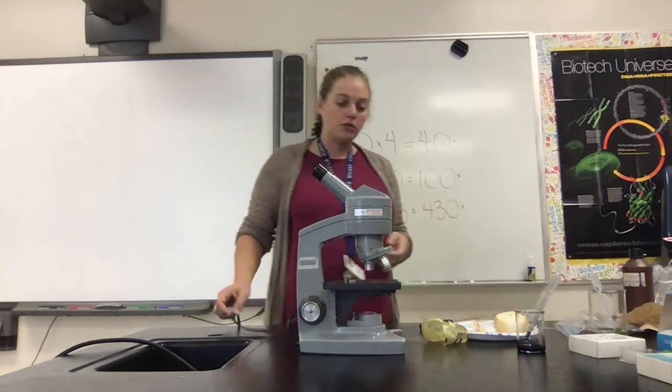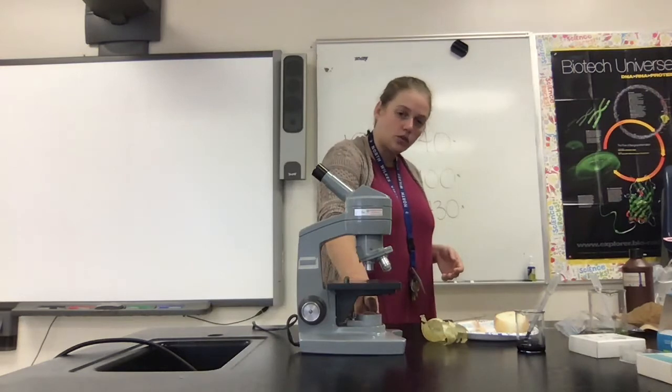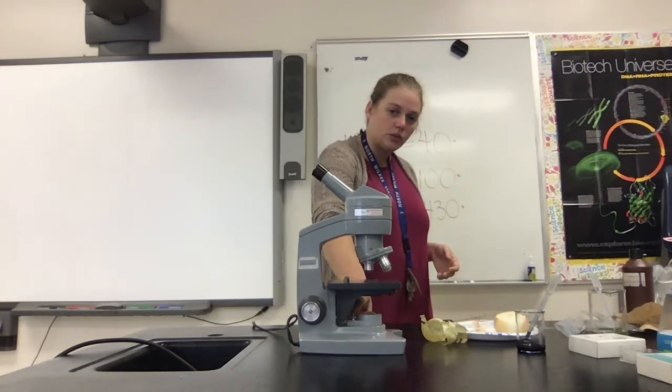When the microscope is plugged in, you have a light source, and there's a switch to turn the light source on and off.